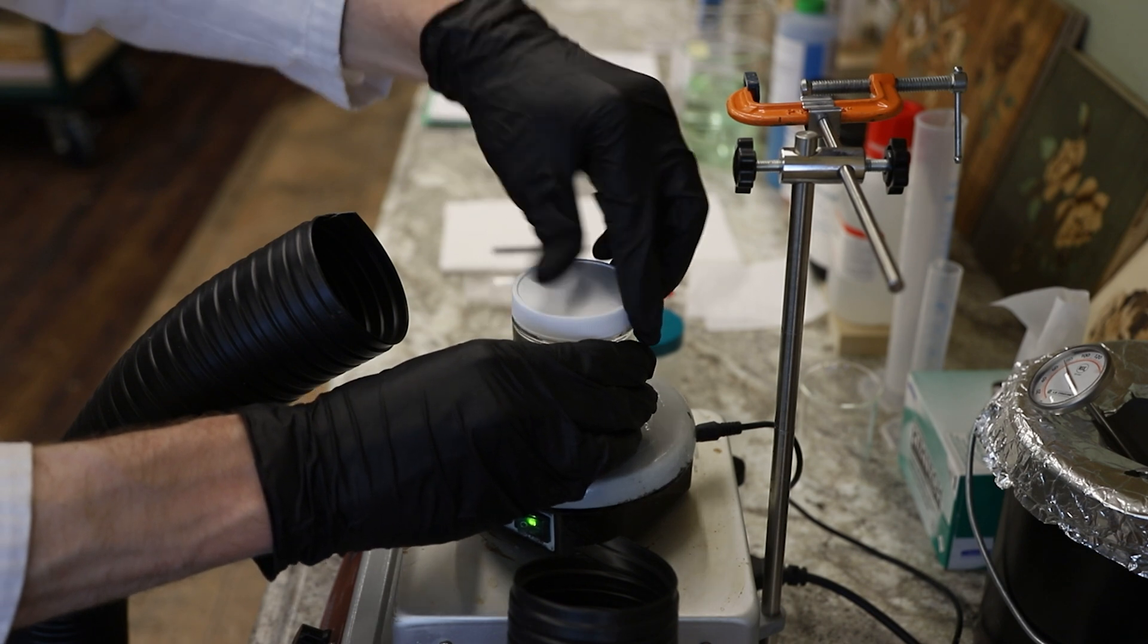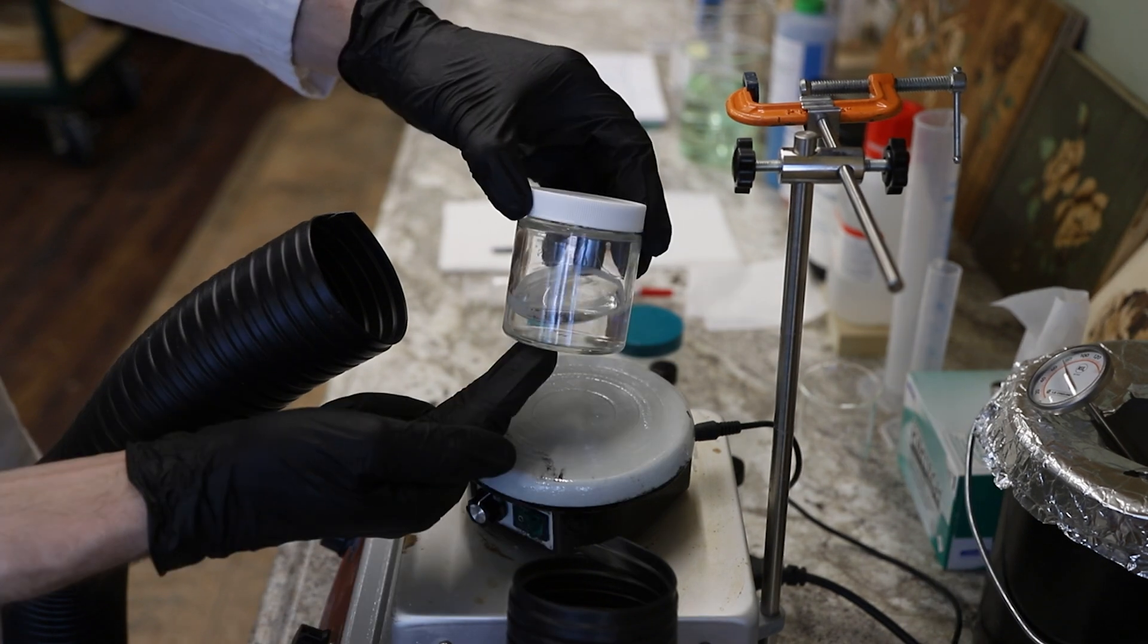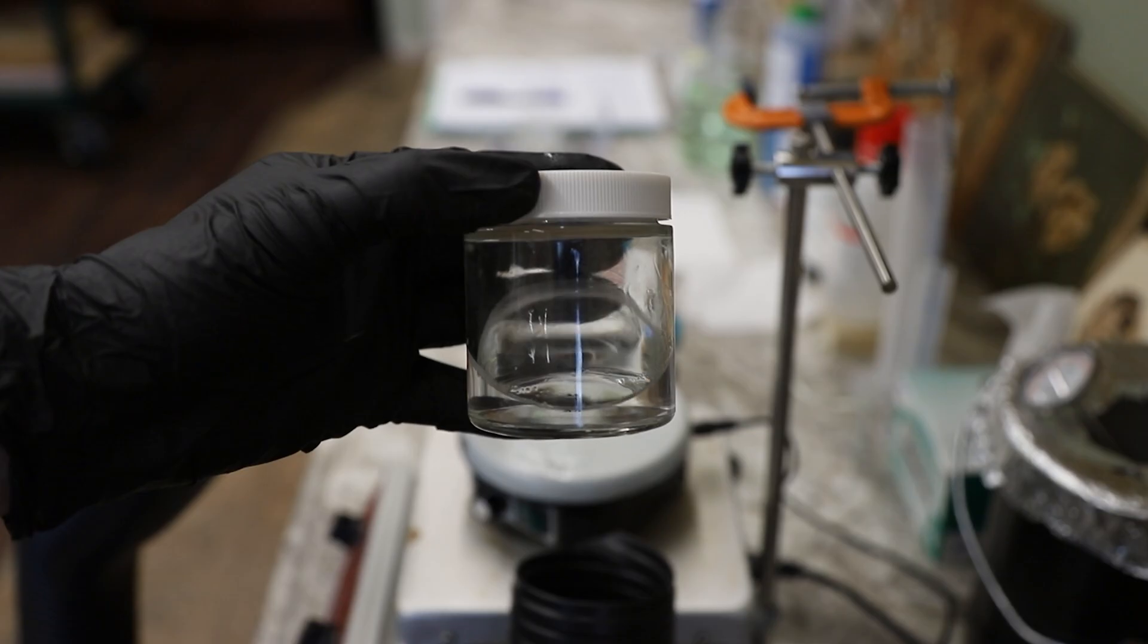So here you have good sized micelles. The solution is totally translucent, and it's ready to be used for de-wetting a polymer film.